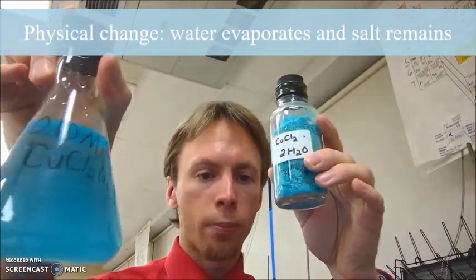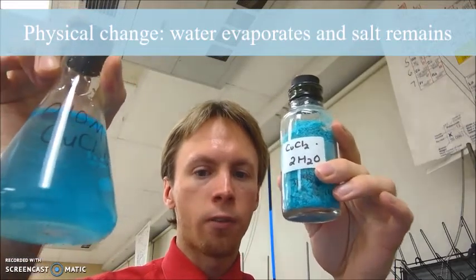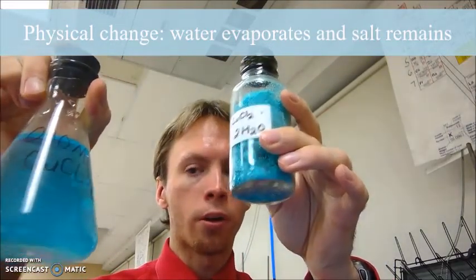So this is a mixture of copper chloride, and if I left this out for a long time, it would turn into this powder of a very similar color. For a mixture, you can take advantage of any of the physical properties of that substance to separate it.